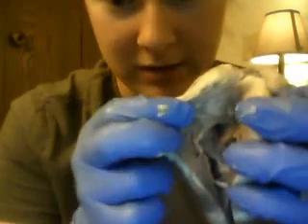So I just cut the heart open. If we look inside of the right atrium, we can see the pectinates, or the stringy looking muscles at the top. They're right around here. And we can see the myocardium, which is the lining, the wall muscle of the heart.